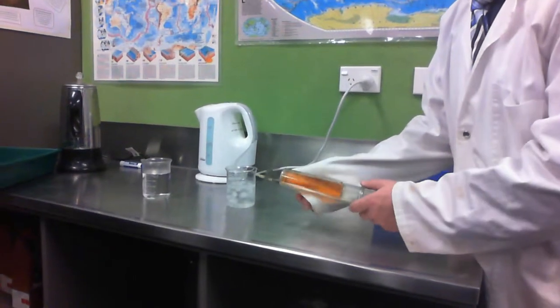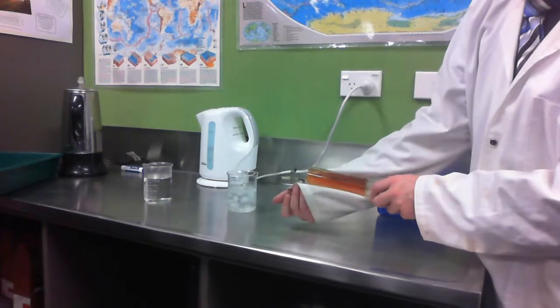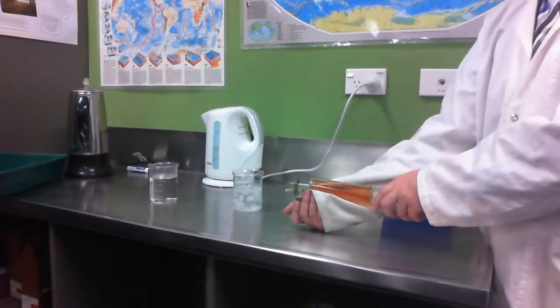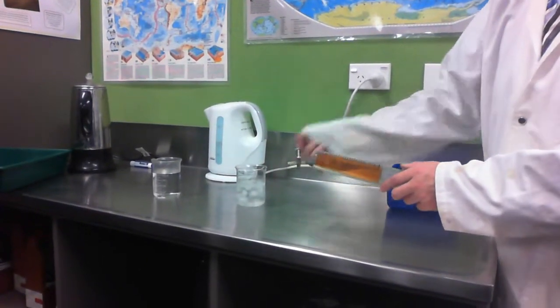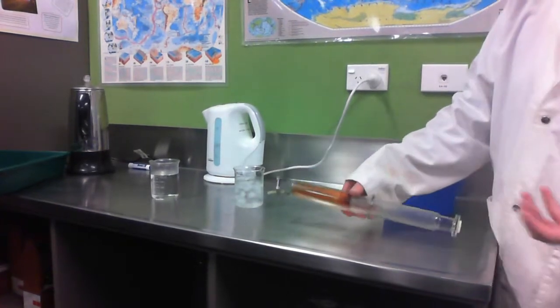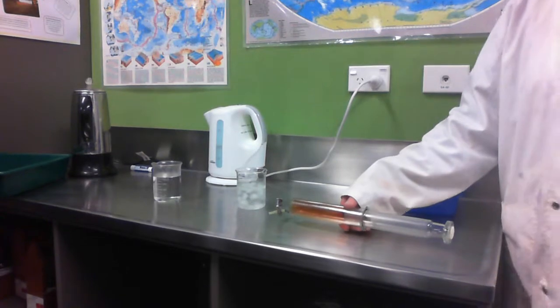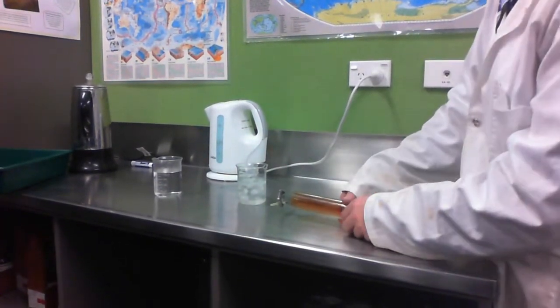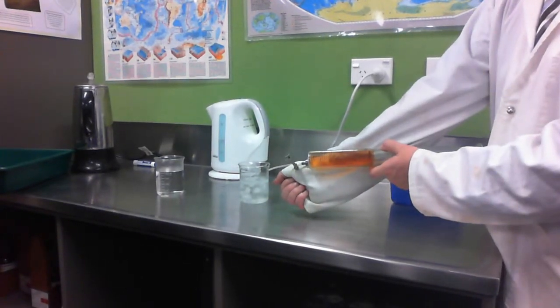What we're going to be looking at here is what's called a dynamic equilibrium. At the moment in this syringe, we've got two gases. We've got NO2, we've got N2O4. They become each other at the same rate. So 2 NO2 turning into N2O4 has the same rate of reaction as 1 N2O4 turning into 2 NO2 molecules. So we don't actually see anything happen, it's just one colour.